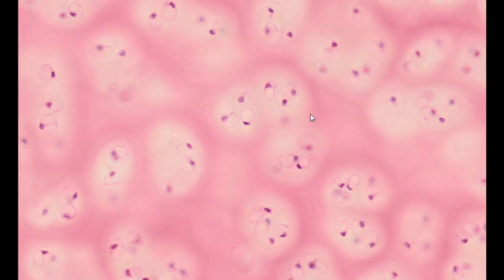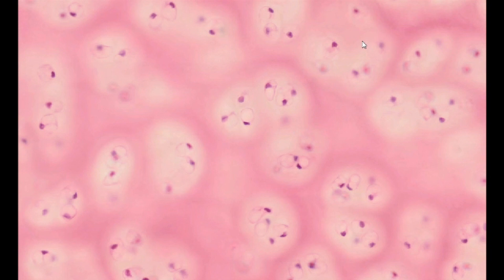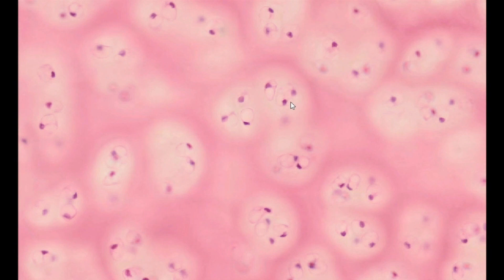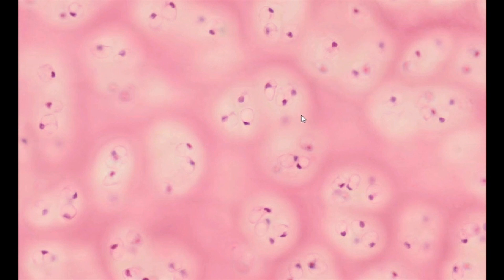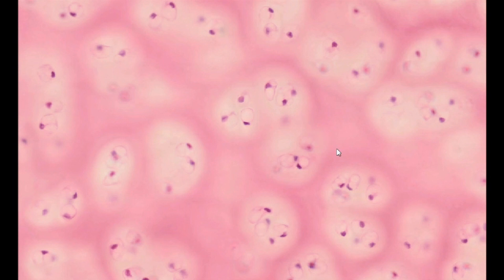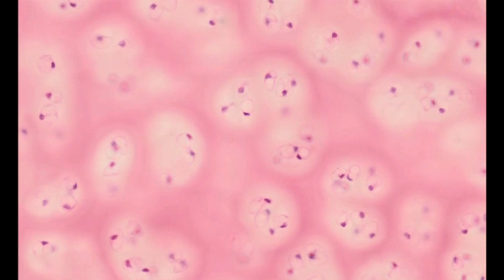This is the so-called isogenous group, formed through division of a single progenitor cell. The free spaces around the cells in the sections are a shrinkage artifact to chondrocytes during slide preparation. In vivo, chondrocytes usually occupy the entire lacuna.